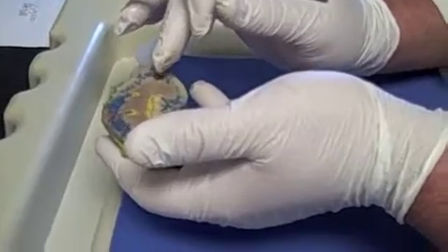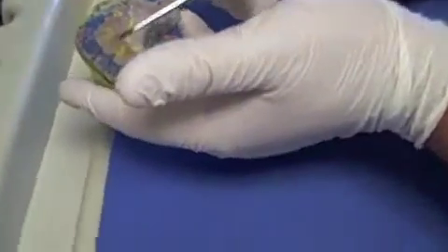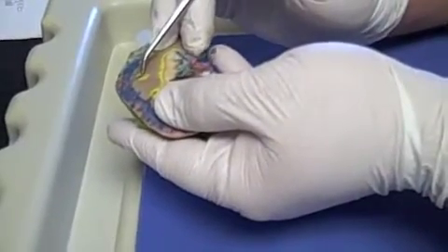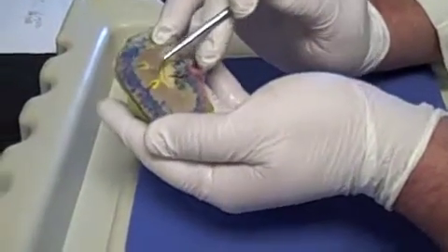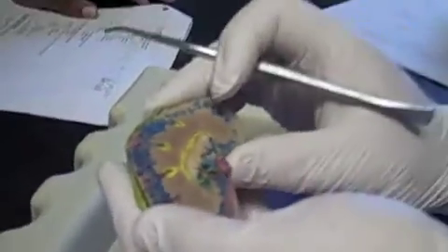Well, what's going to happen is those lobar arteries are going to branch out from one another and start running up in between each one of these medullary pyramids, these renal pyramids, okay? And when they do, they're going to be called interlobar arteries, okay? And that's what that little red guy is right there. You see it? Right there. Inside of these yellow circles.